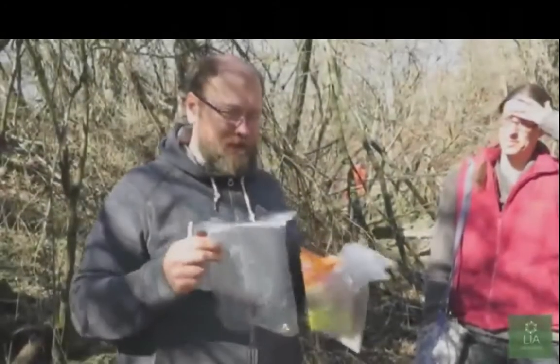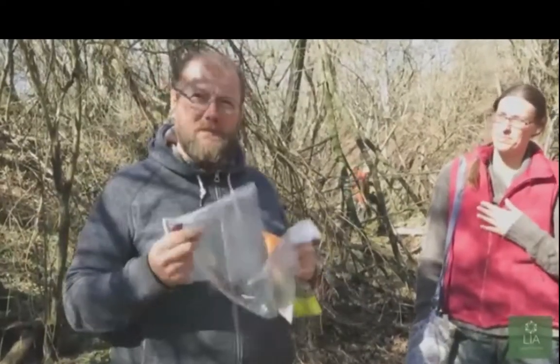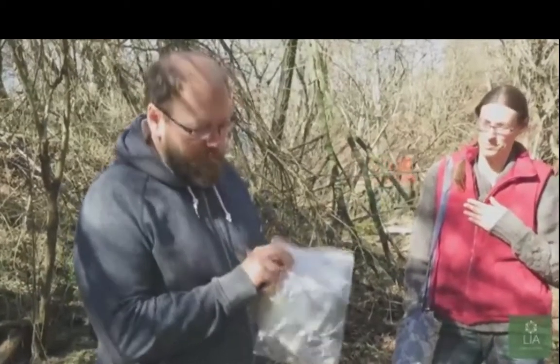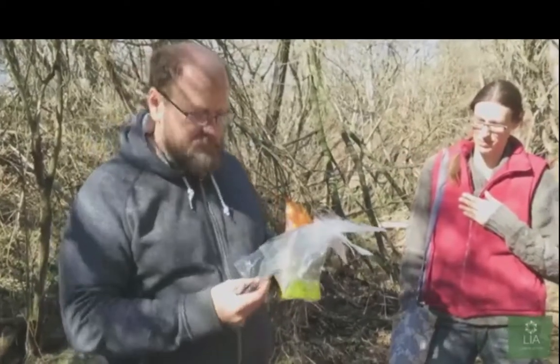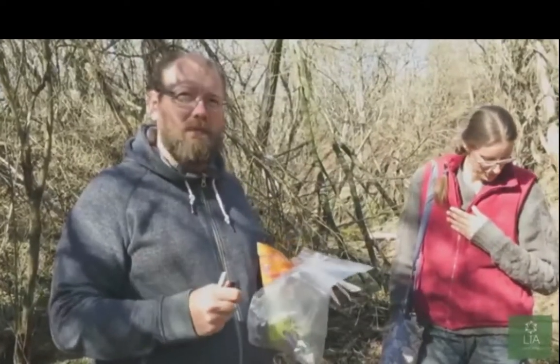Unlike traditional mycology, we don't necessarily know what mushrooms these are going to be, because we're doing research on material aspects of mycelium. We're just going to grab a whole bunch of mycelium samples that we've collected. We don't necessarily need to know what they are just yet. What we're going to do is take these, put them back into Petri dishes, sprout them out and see what grows, and we're going to grow them out over the next few days or weeks and see what they become.